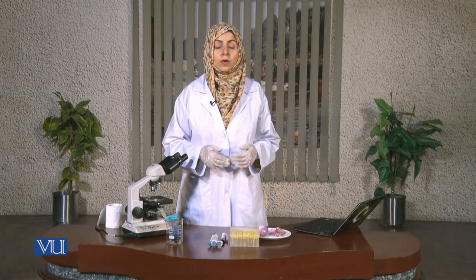If you don't know how to use the microscope, you should seek guidance from colleagues or a teacher. You should not ingest your stains. If the stain gets on your gloves or hands, do not touch your eyes or skin with those stained hands, because it is toxic and can cause irritation on your skin. That's all for performing this experiment. Thank you.